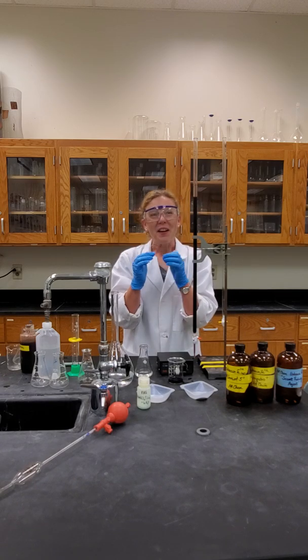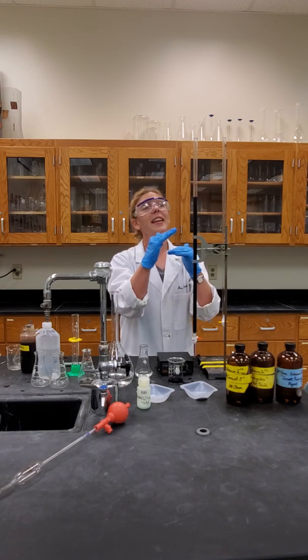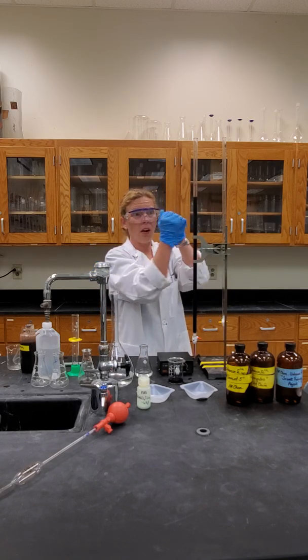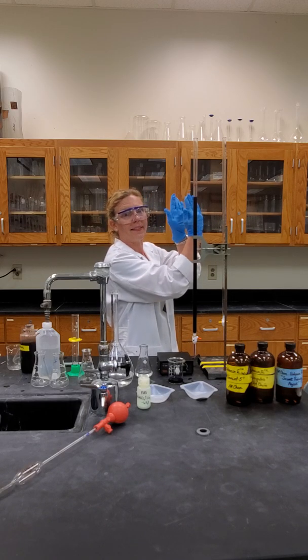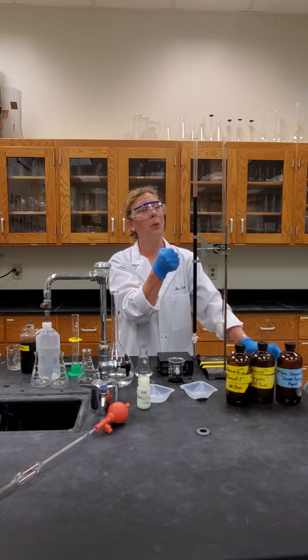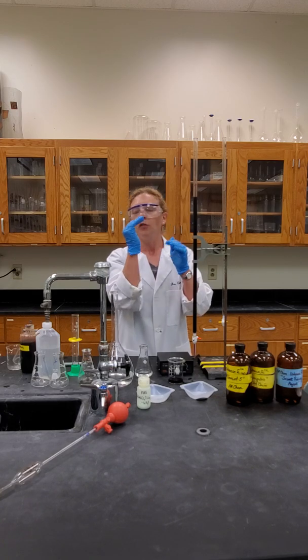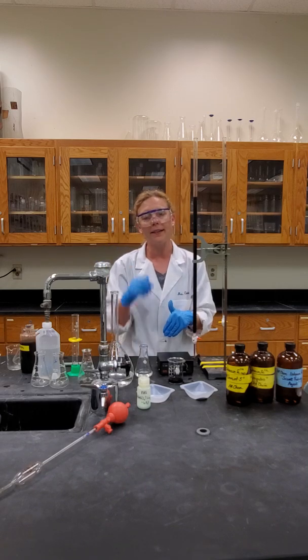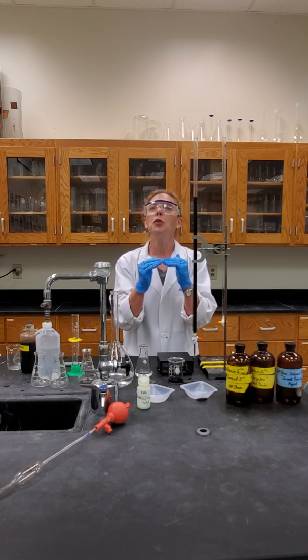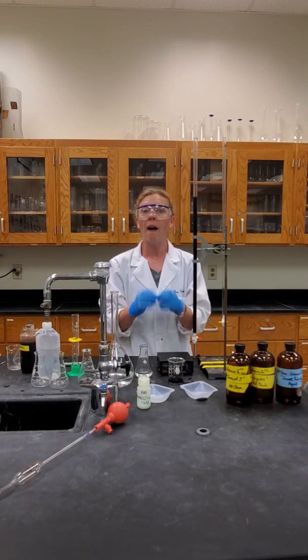You need to talk with your lab partner because this liquid is so deep in color it's tricky to read the volume. Make a decision together: is it easiest to measure the very top where the liquid meets the sides of the burette? We know we read the bottom of the meniscus, but with this deep-colored liquid, reading the top may be easier — or can you see a reflection and read the bottom of the meniscus? Decide with your partner and ask me for guidance. With this titration we are after the difference in volume, so as long as you are consistent — always from the top or always from the bottom — you will get fine results.